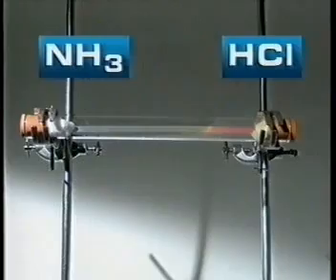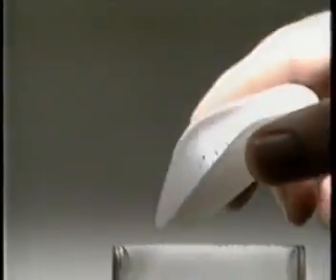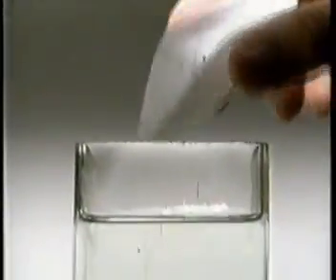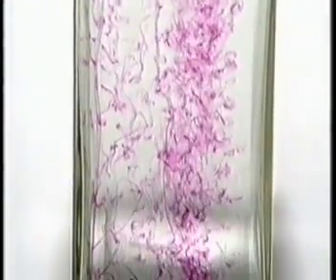Why does ammonia travel faster? Diffusion also happens in liquids. Drop potassium permanganate crystals into water and they begin to dissolve. The purple solution then spreads out and diffuses through the water.